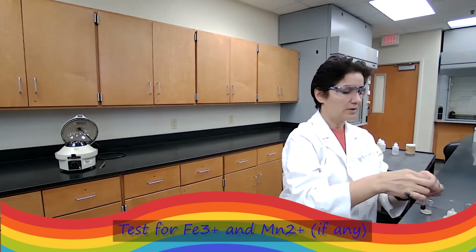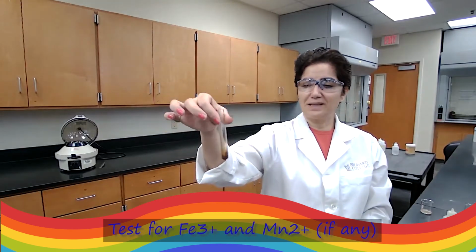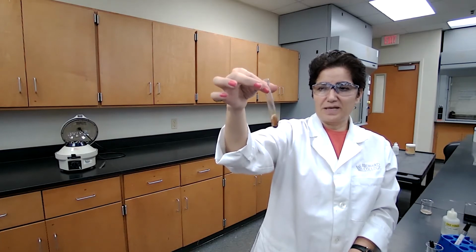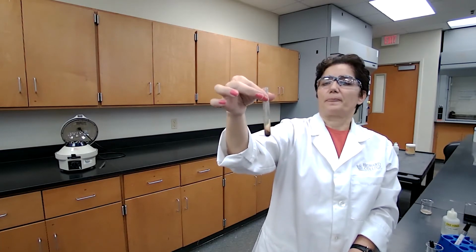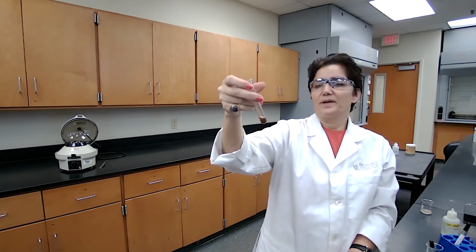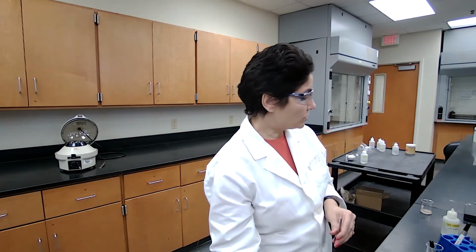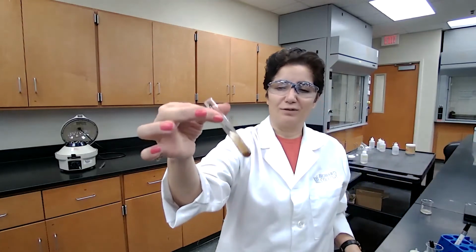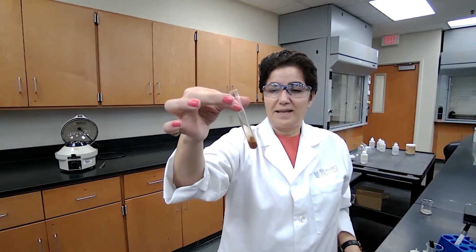Now we can start working on the precipitate that we had previously for iron and manganese. The precipitate should have been dissolved already. I'm just going to add a couple extra drops of the nitric acid to make sure that everything is dissolved, because we moved fast and it didn't have enough time to dissolve. So we are on the next step now, testing for iron and manganese.